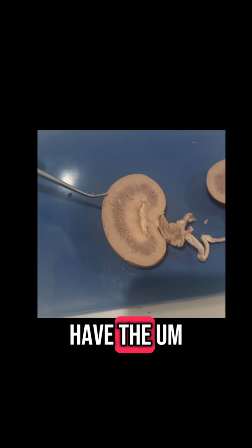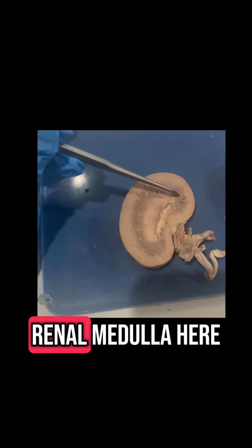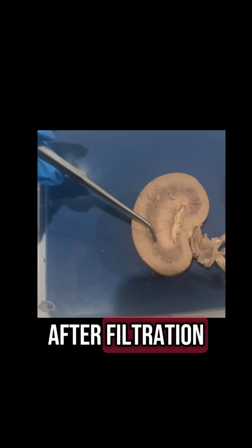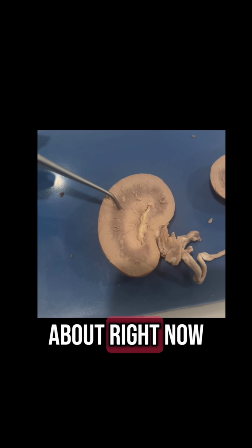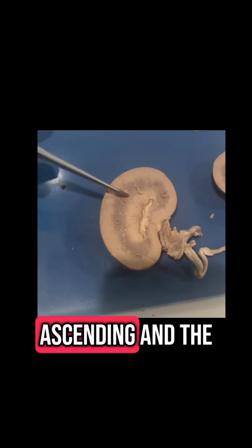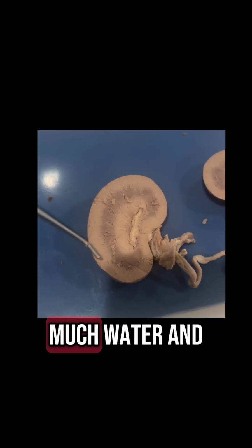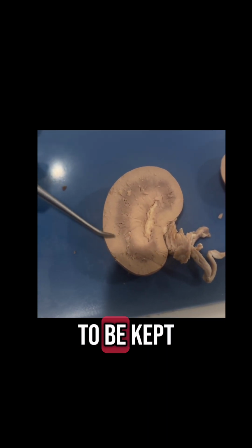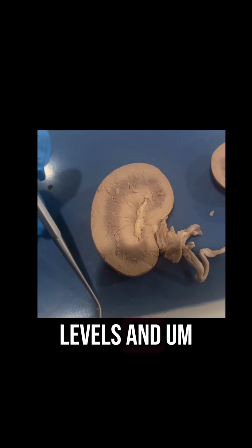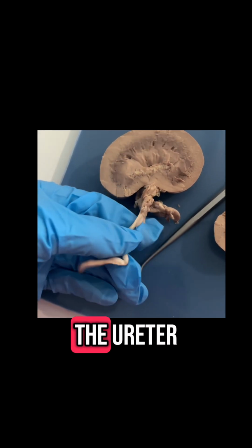Okay, next we have the inner part of the kidney. The darker part here is going to be the renal medulla. This comes into function after filtration. The filtration moves into this part we're talking about right now, the renal medulla. It contains the nephron loops, the descending and ascending, and the collecting ducts as well. The renal medulla is also the location that adjusts how much water and salt in the kidneys is going to be kept or removed and excreted from the body to balance the hydration levels and form concentrated urine instead of diluted urine.